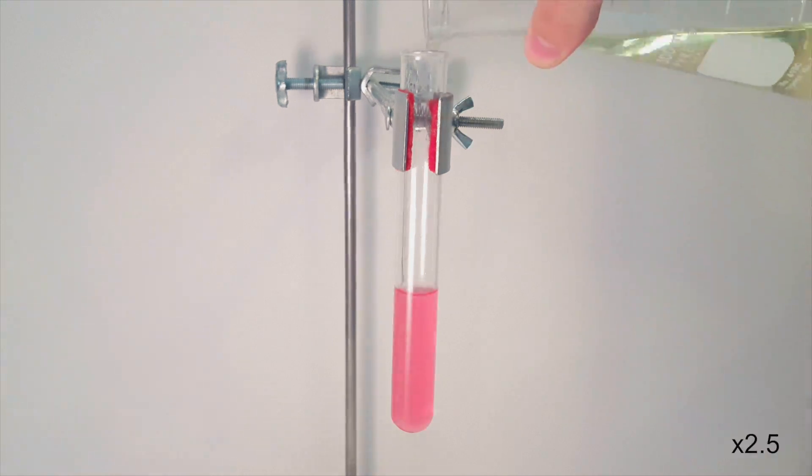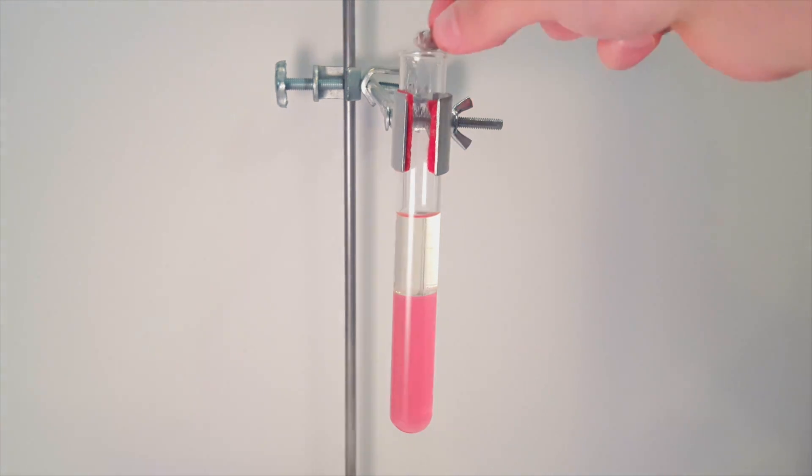Then on top, I added the gasoline. When the sodium is dropped in, it sinks to the bottom of the gasoline. Then it reacts with the water to produce hydrogen gas, which propels it upwards. You can clearly see the color change on top of the indicator solution to a greenish yellow.